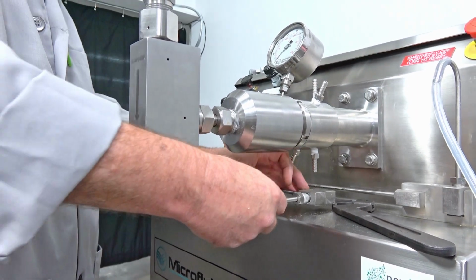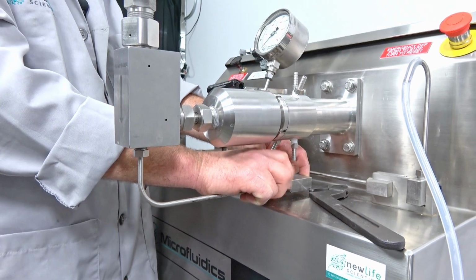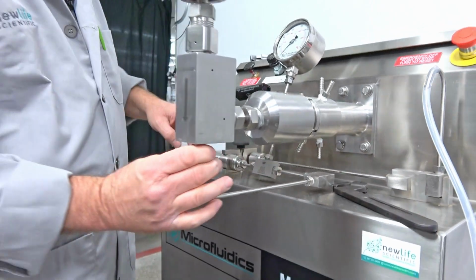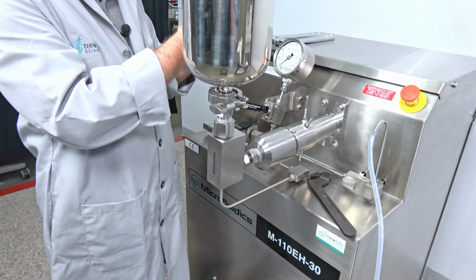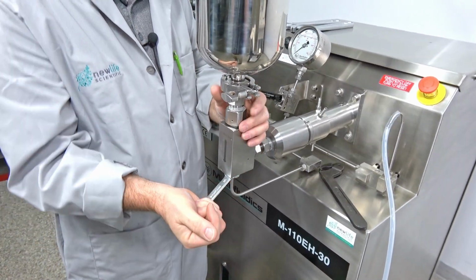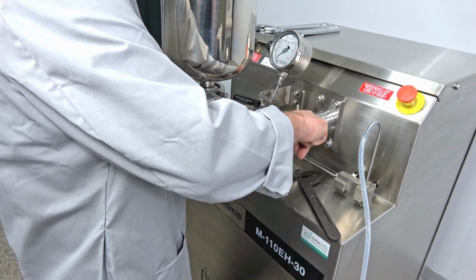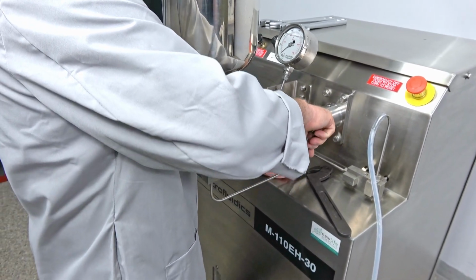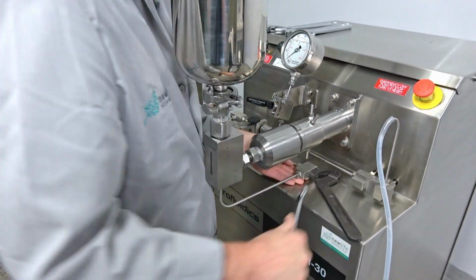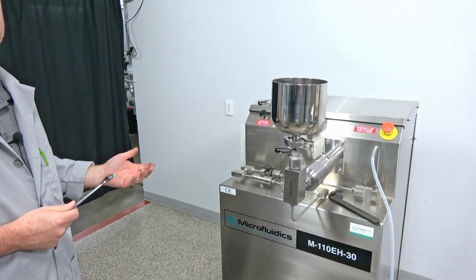And then back here, same thing. Tighten it as far as you can with your fingers. And then the 5/8 inch wrench, just for that final tightening. Just a nice snug, don't over tighten it, but don't under tighten it. I get my hand up under there, give it a little support, and give it a nice snug fitting. And then we're back ready to run production again.